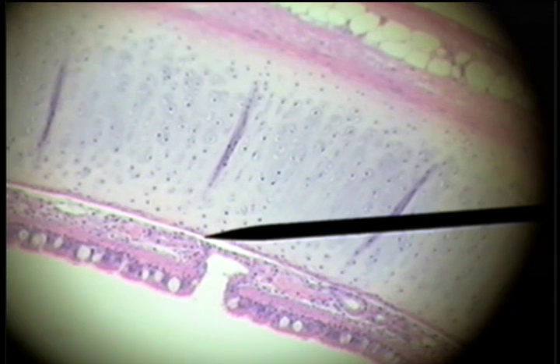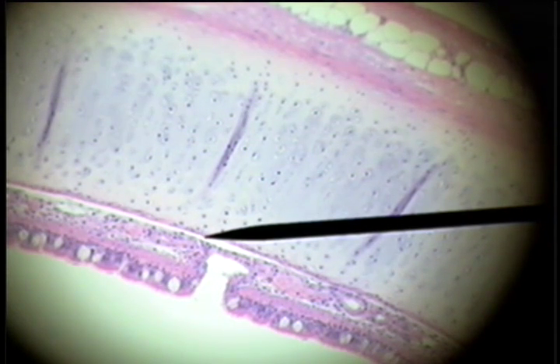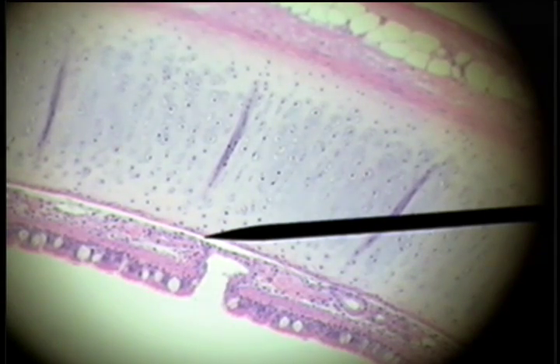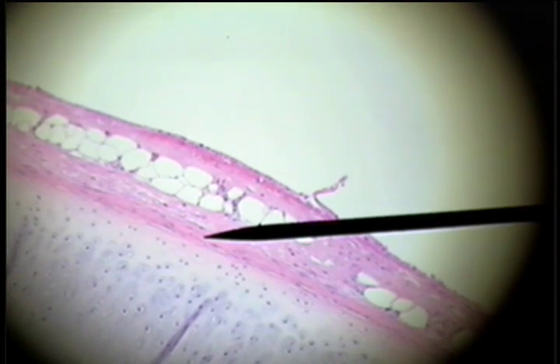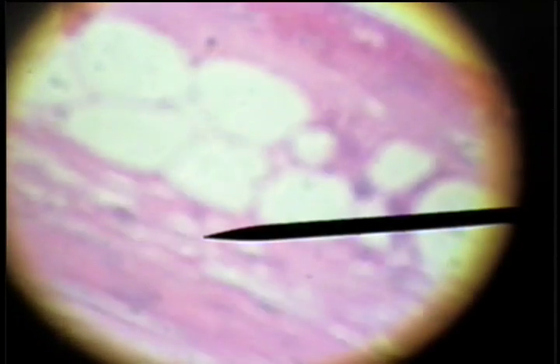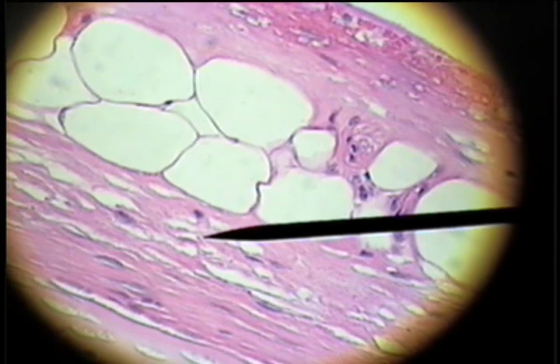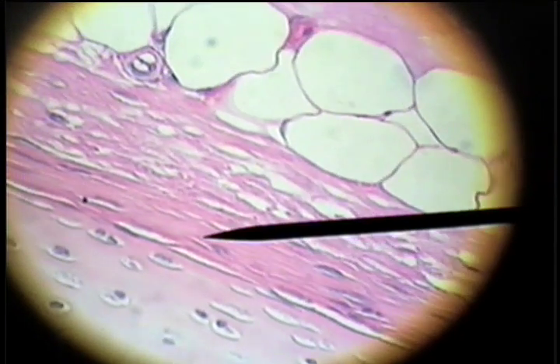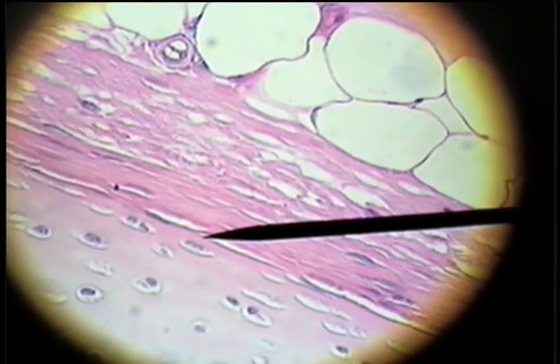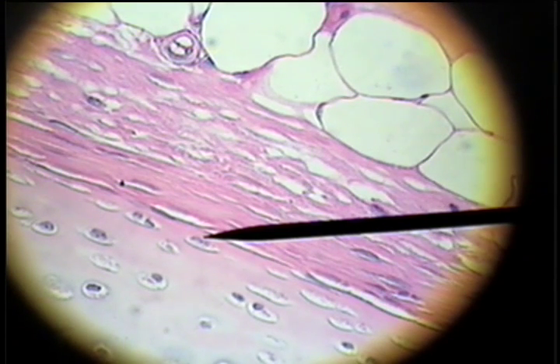The cartilage has a growth layer on the outside where growth begins. This is the perichondrium, and the perichondrium is this eosinophilic or pink layer on either side. If we look at the perichondrium under high power, we see that it has an outer fibrous layer, and then this inner cellular layer where these hyaline cartilage cells called chondroblasts are beginning to develop.